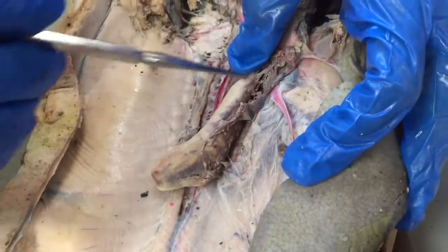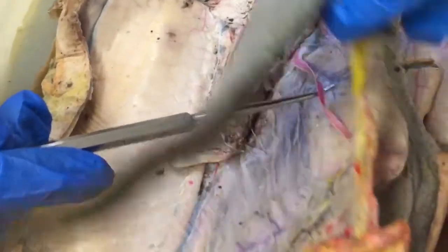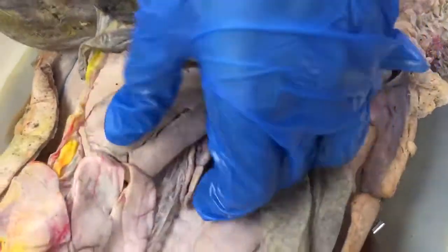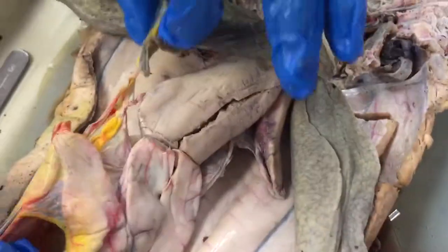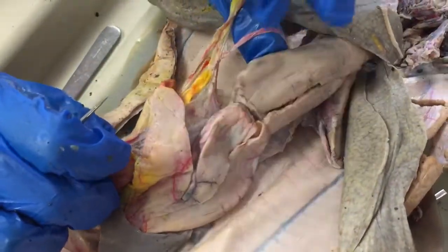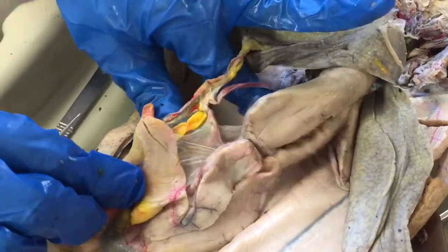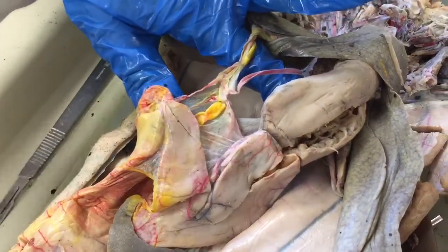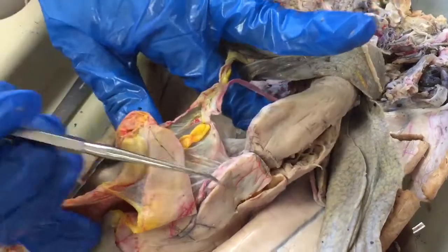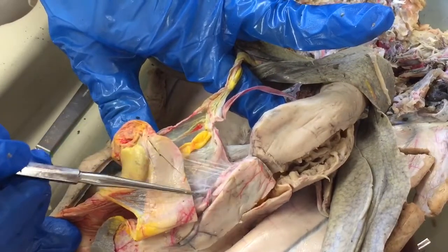If it were a female, those would be ovarian arteries. We're going to follow our celiac artery here and remove this lobe of the liver so we can see everything. For reference, here's our J-shaped stomach, here's our liver. There's quite a bit of artery and vein information in this area. This is our celiac artery coming up here.